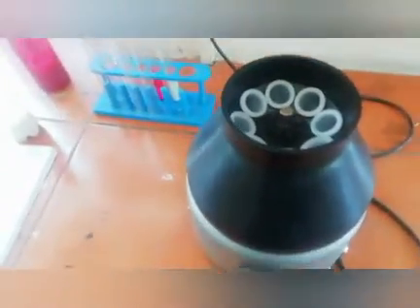Whereas in case of this, you can see on the top it is white and in the bottom it is yellow. If you need to see it clearly, it is white on the top, then it is yellow, and in the bottom again it is white. Okay, so it means that the cream will separate from the solution. So this is the process how we can separate the cream from solution. So this was the centrifugation method.